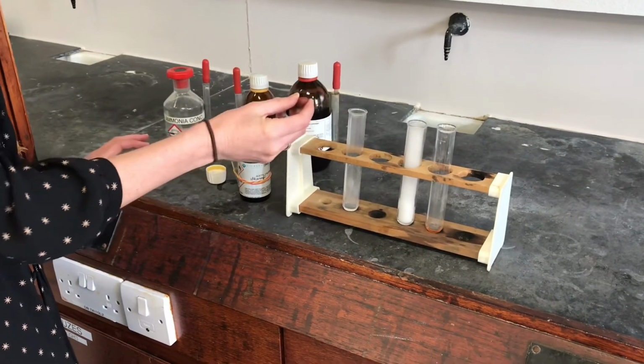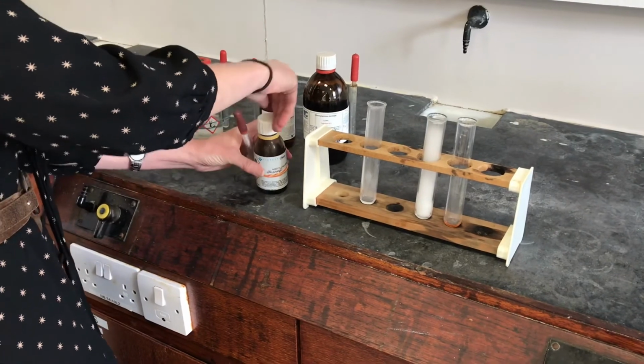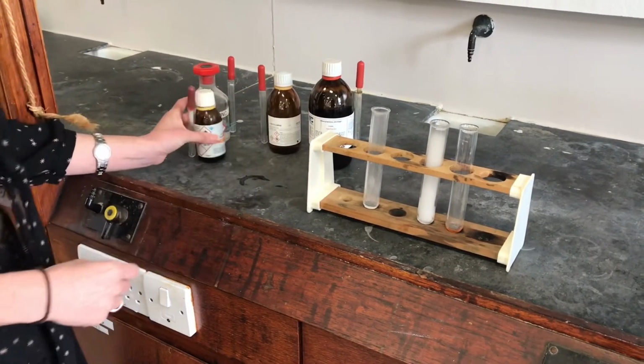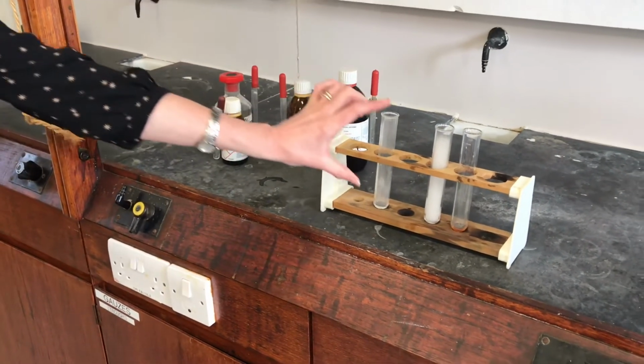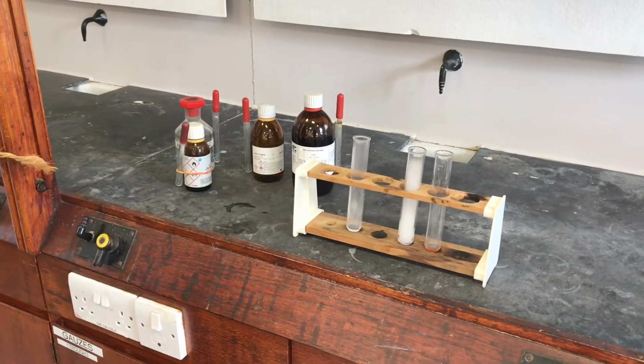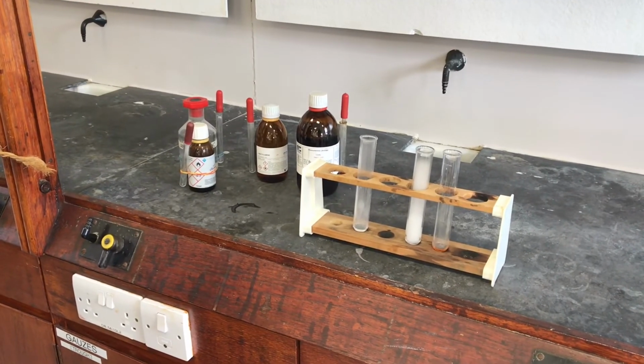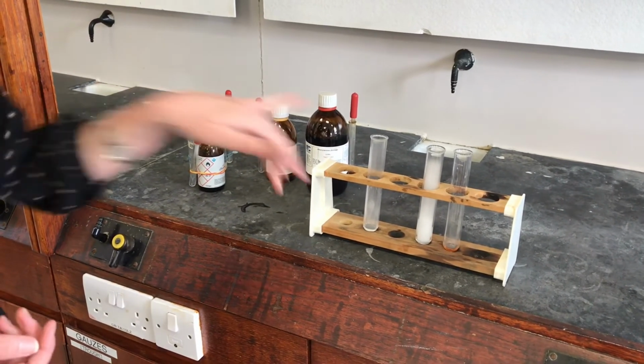But you can hear, I think, every time I add some of the ethanoyl chloride, it's making almost like a banging noise, a sort of sizzling bang. It's getting quite exothermic in there, and you can see it's made a whole load of those white fumes again. You might like to have a think about what those white fumes could potentially be. I'm going to pause again while I turn the fume cupboard on so I can get some more fresh air, and then we'll come back to do the last one.